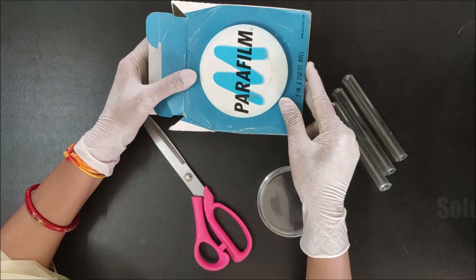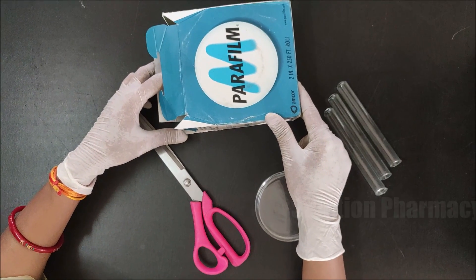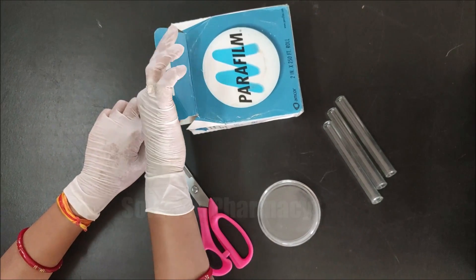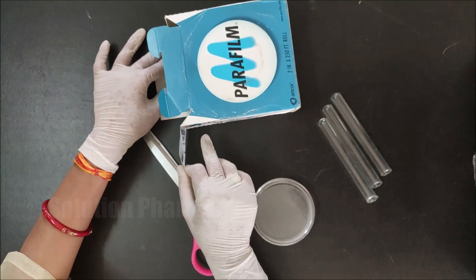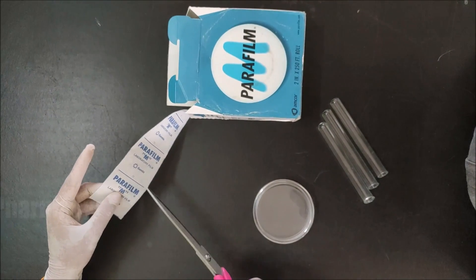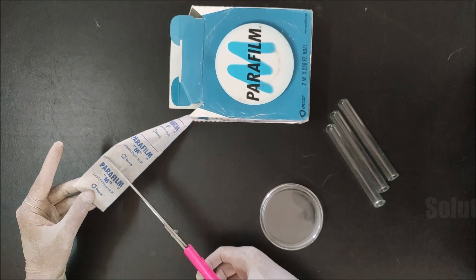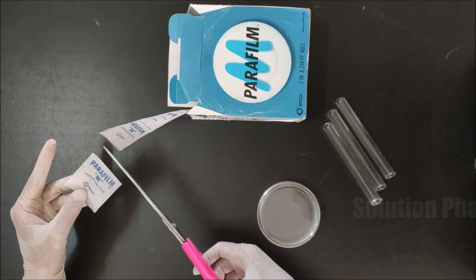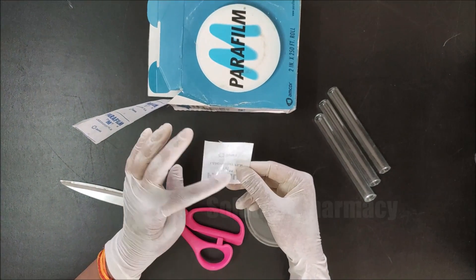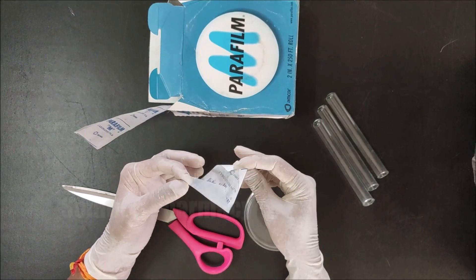Next we will show you how we use parafilm for sealing. First I will show you how to seal a test tube using parafilm to make it liquid-proof. From the box, we pull out and cut a strip of parafilm according to our need, to prevent contamination of the complete roll. Since we only need to seal one test tube, we require only a small piece of parafilm.